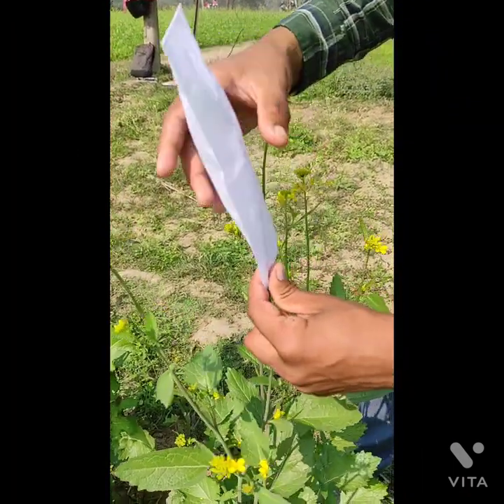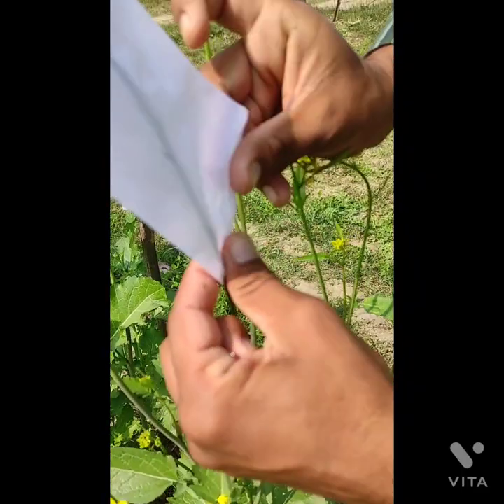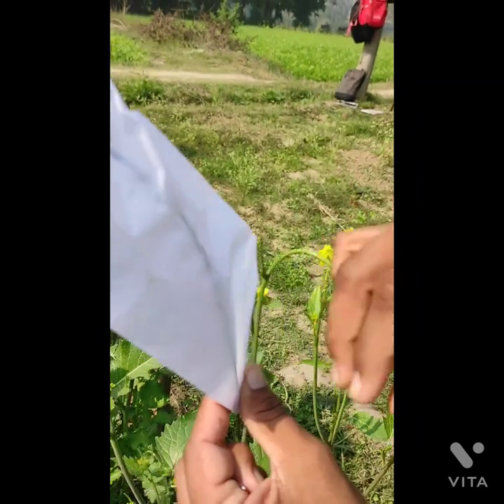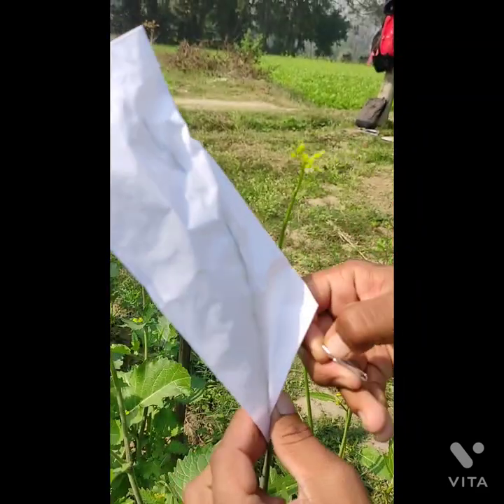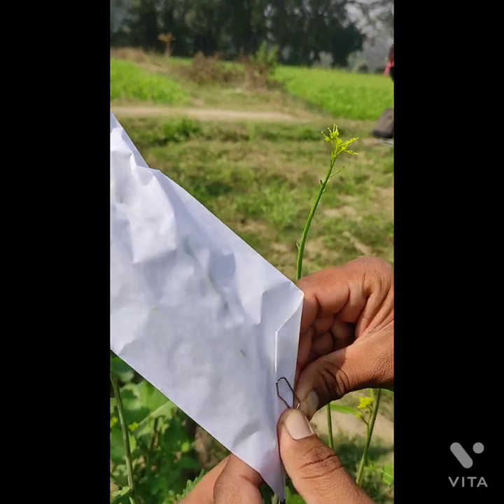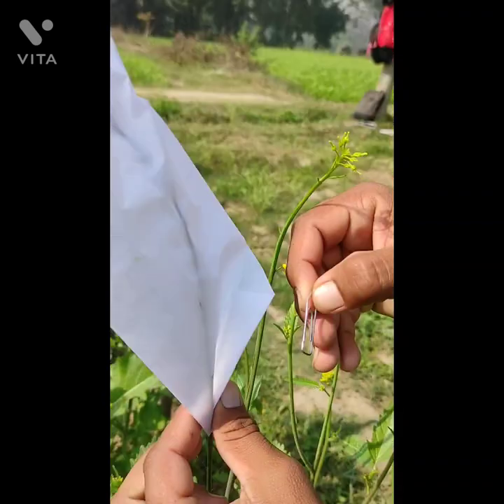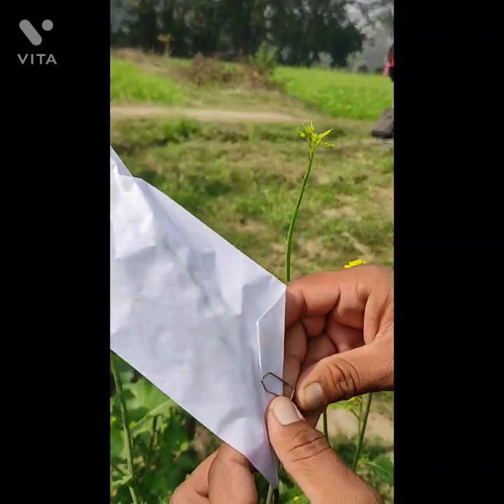The emasculated flower buds should be safely inserted into the butter paper. It should be inserted through one side and the remaining end of the other side should be folded. A U-pin is used to keep the butter paper closed. This is done to prevent the contamination of the stigma with unwanted pollen.